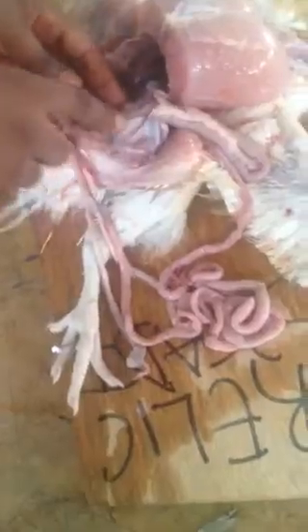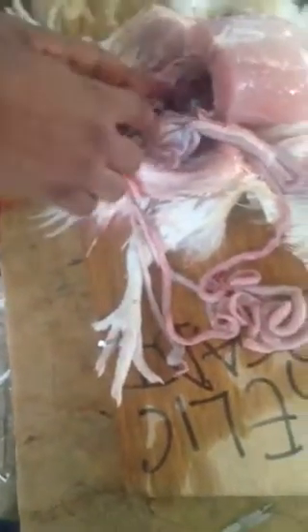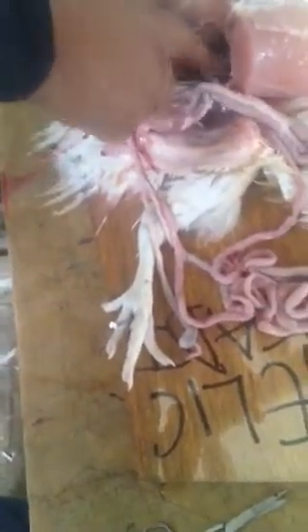So please, when you do that, it is very imperative that you put here duodenum. Look at it, the pancreas. When your pancreas is constituted, what do you have here? This is a gizzard. The gizzard does what? It also swallows stone to grind food. From the gizzard, we have what here? The liver. The liver functions in digestion.